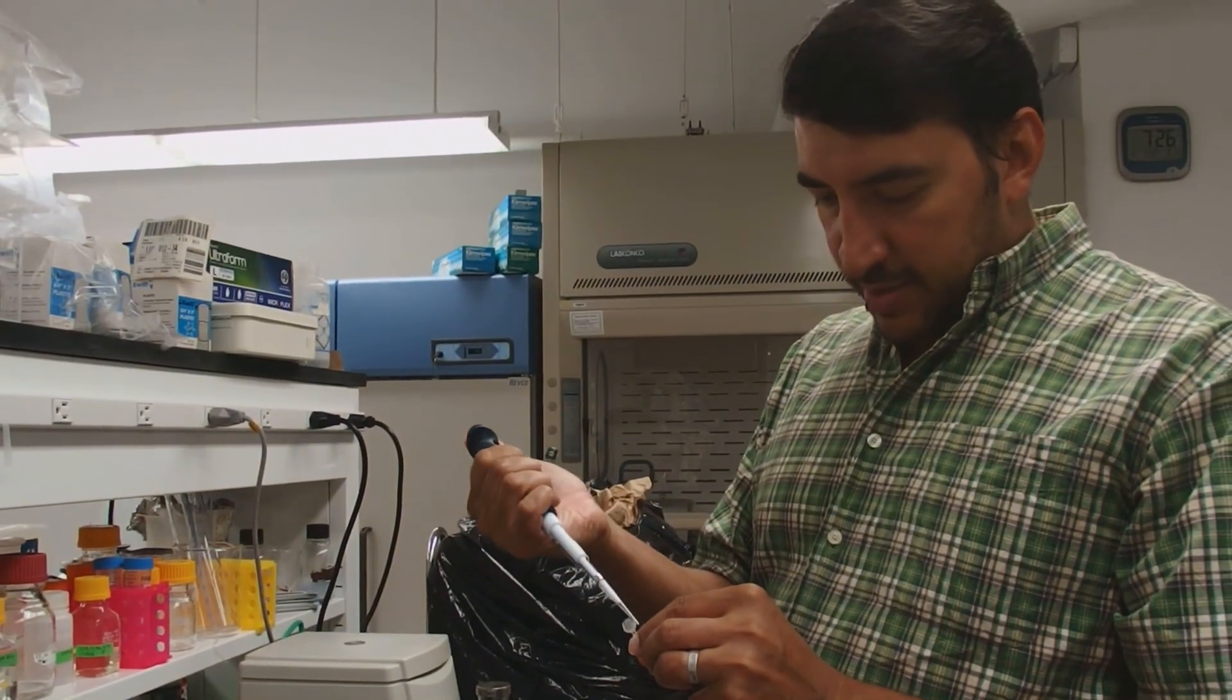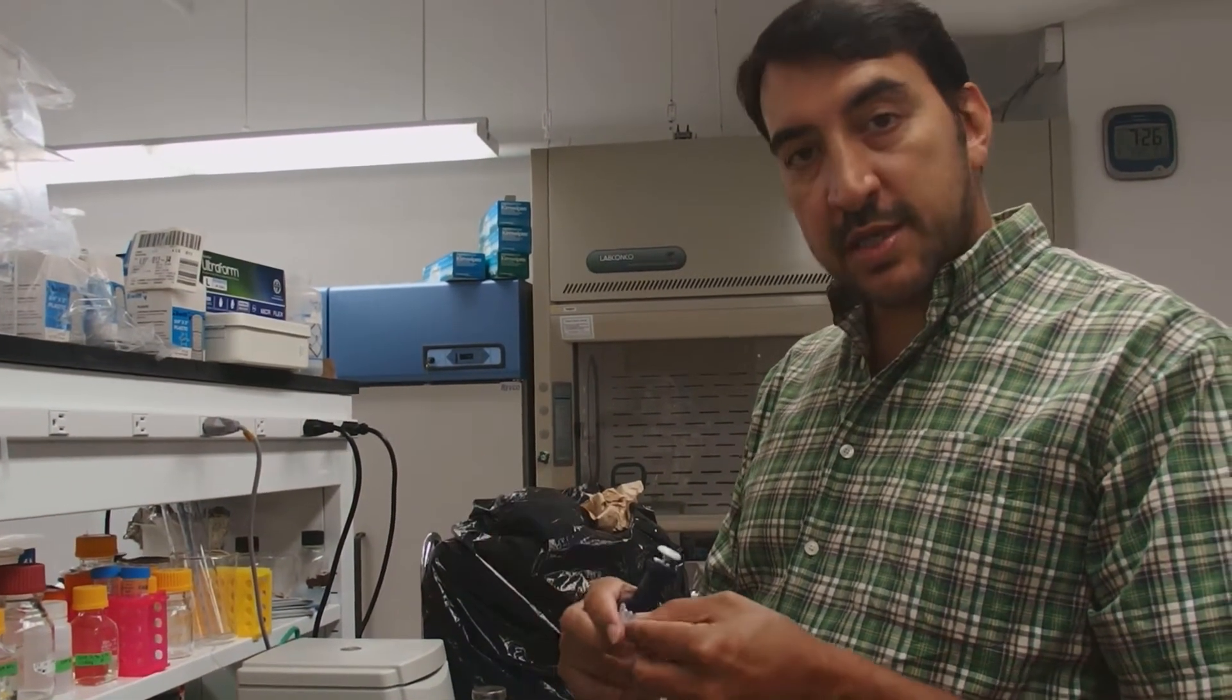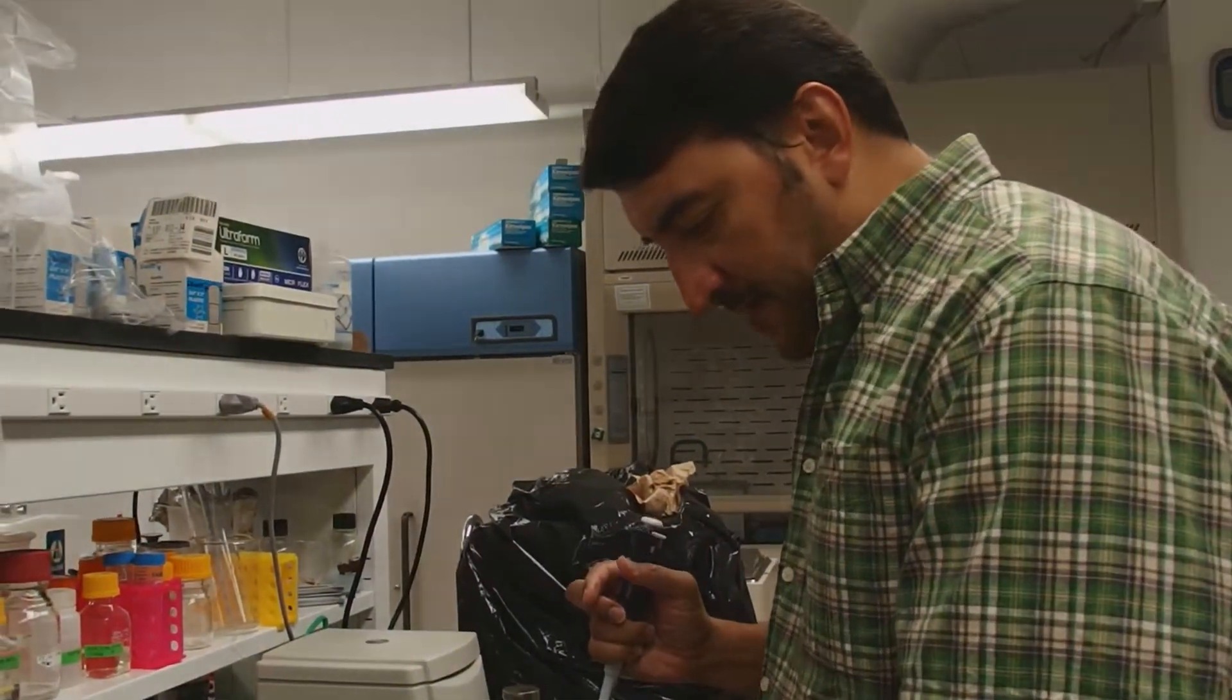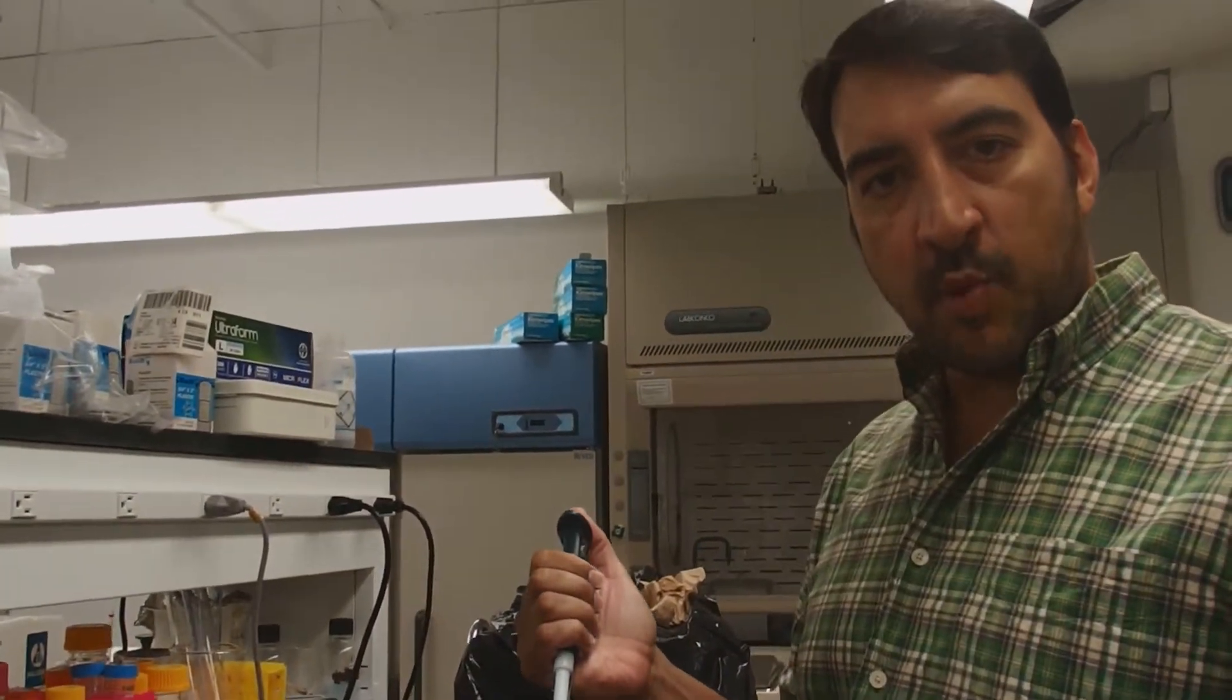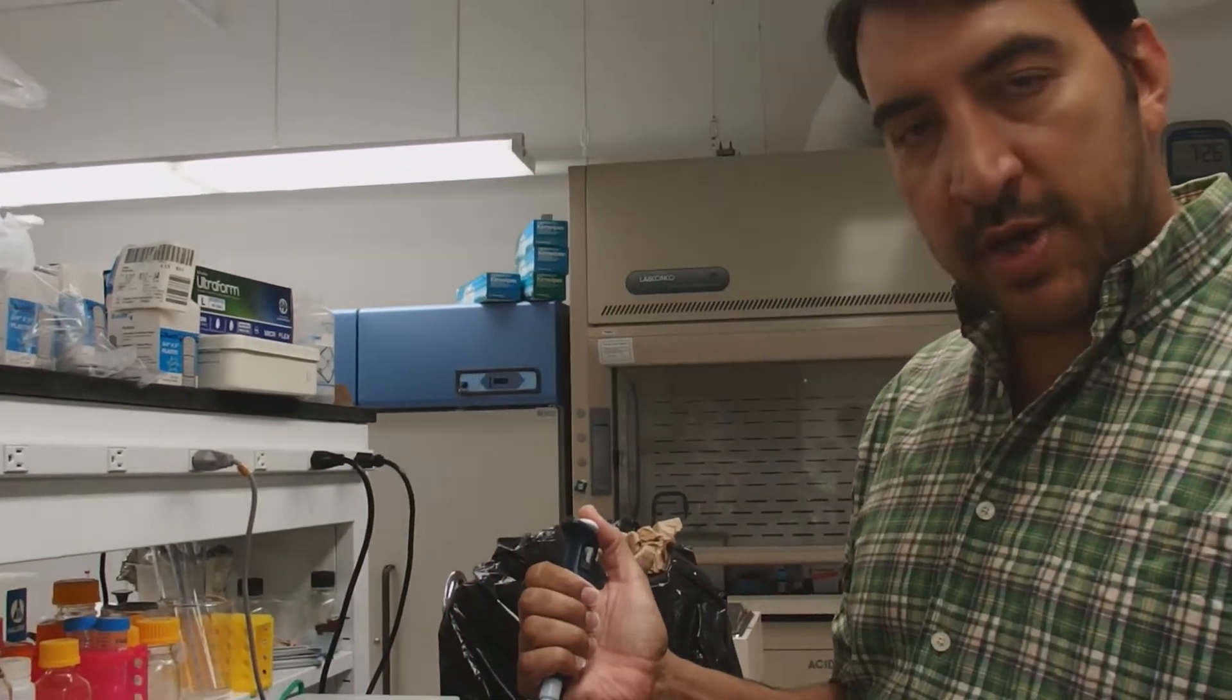I'm going to load my slide agarose gel. It has very small wells, so I'm going to load about 50 nanograms of 1KB plus ladder into two different wells.